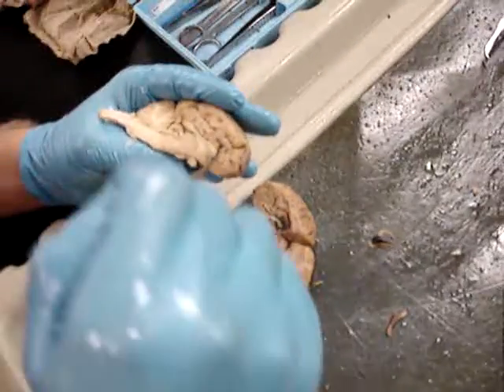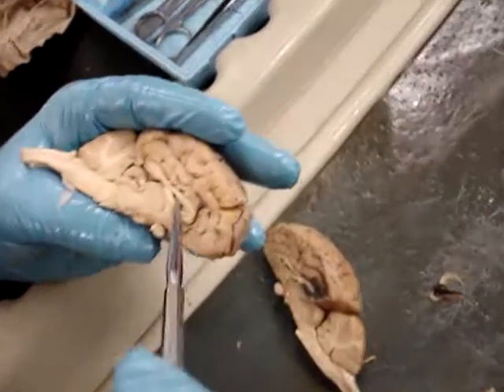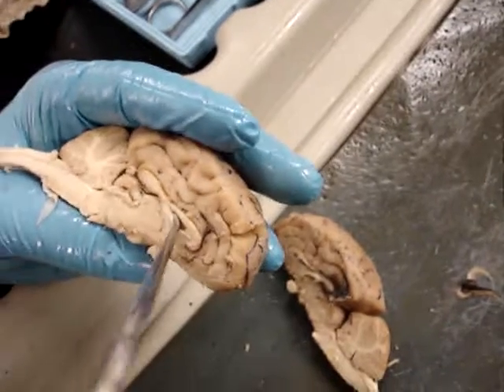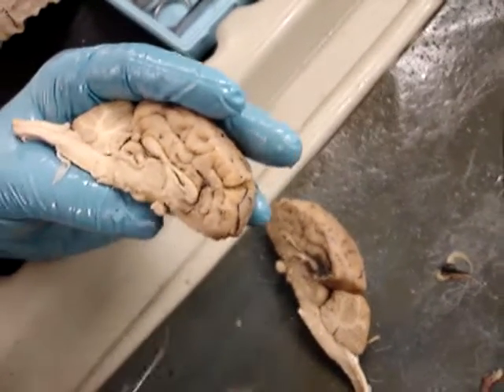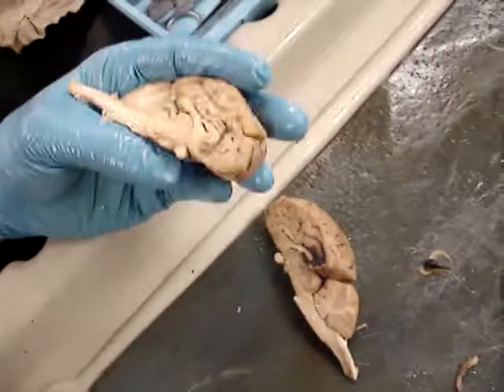The first ventricle is also called the lateral ventricle. The fourth ventricle is back here, but we don't even have to know it.